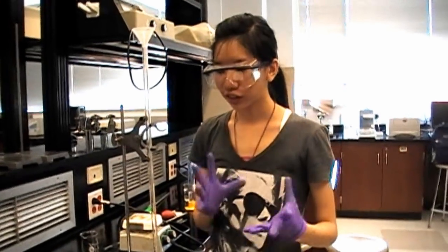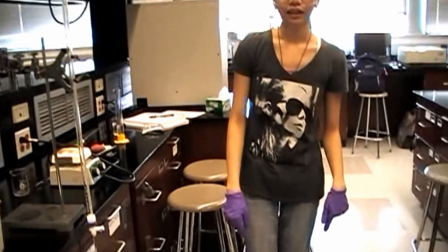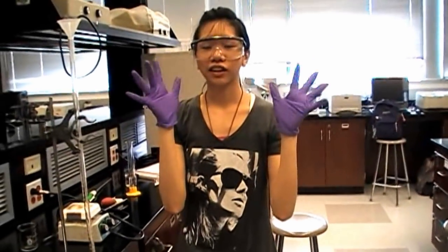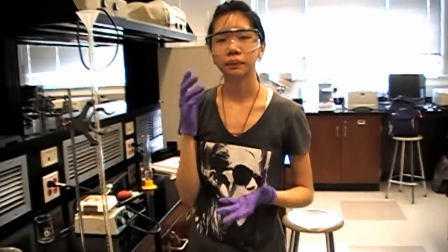Before starting the experiment, you want to have closed-toe shoes, your safety goggles, and latex gloves on because you'll be dealing with nitric acid and sodium hydroxide, which are strong acid and strong base and highly concentrated.